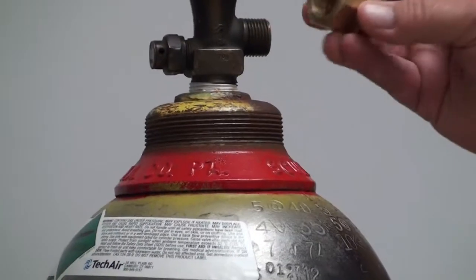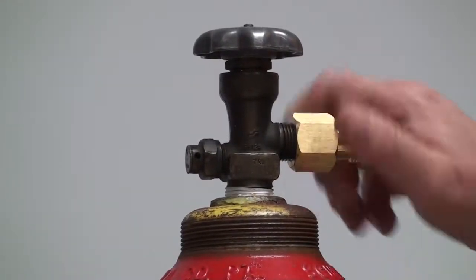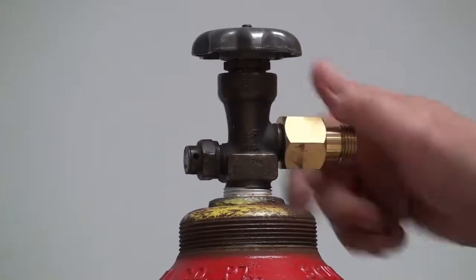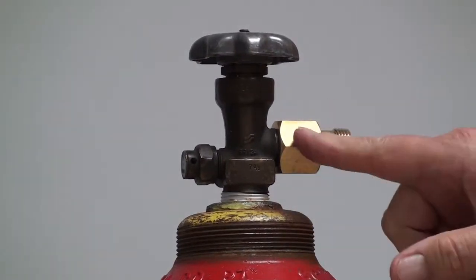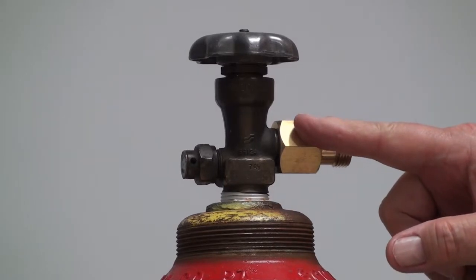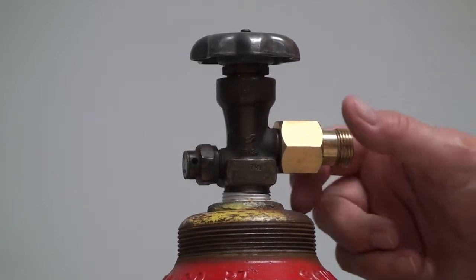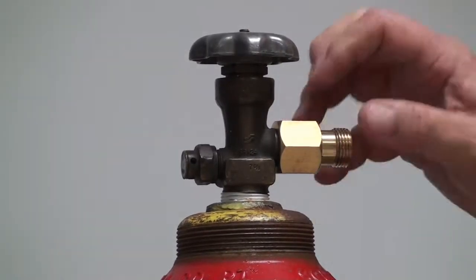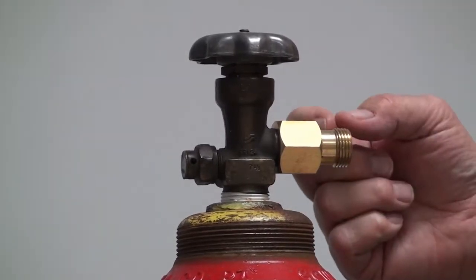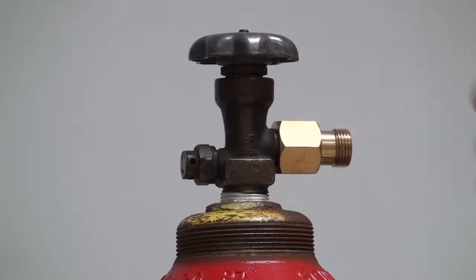So you take the brass fitting and screw it onto the tank. It is always useful to put Teflon pipe tape. And don't forget any additional washers or seals. There is a fiber washer inside there, a plastic Delrin, which makes a good seal against the valve surface.